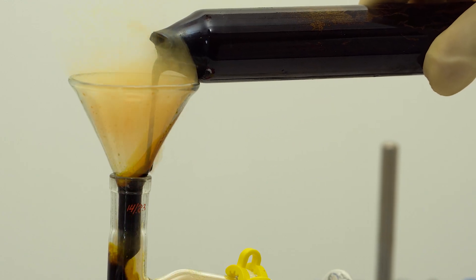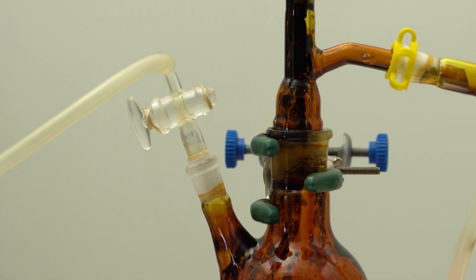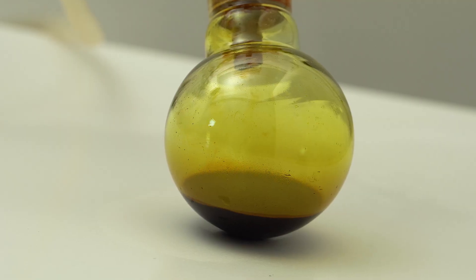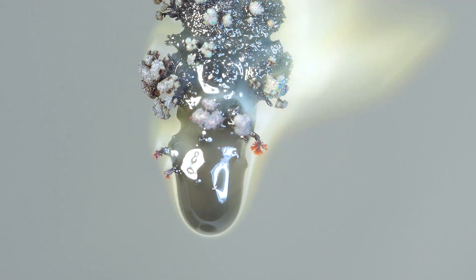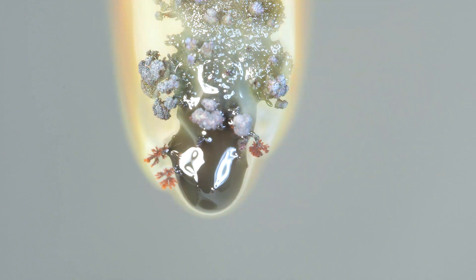Hey guys, I'm going to make a video about liquid vanadium tetrachloride, and I thought that before that it would be nice to make a video about the preparation and some properties of vanadium trichloride.